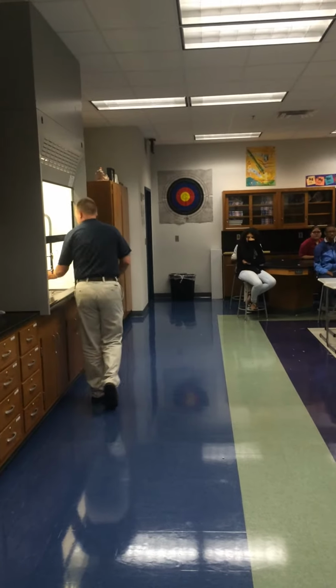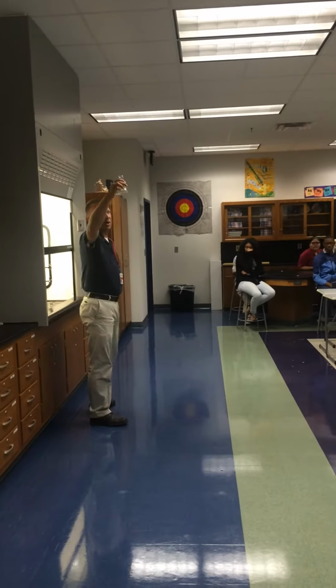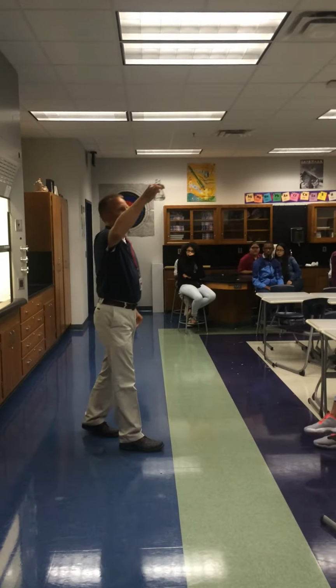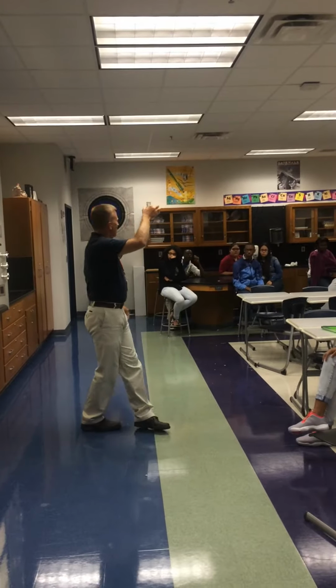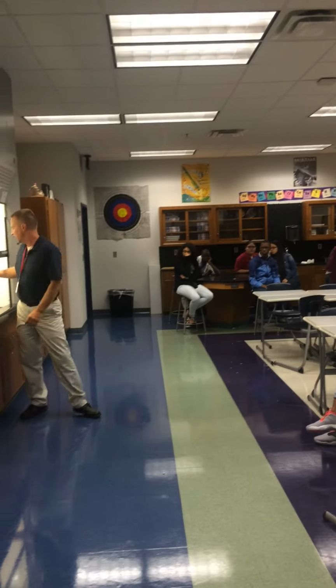I'm just saying. First thing I'm going to use is an Erlenmeyer flask. Okay? It's flat on the bottom. I'm going to put some liquid in here. Okay?